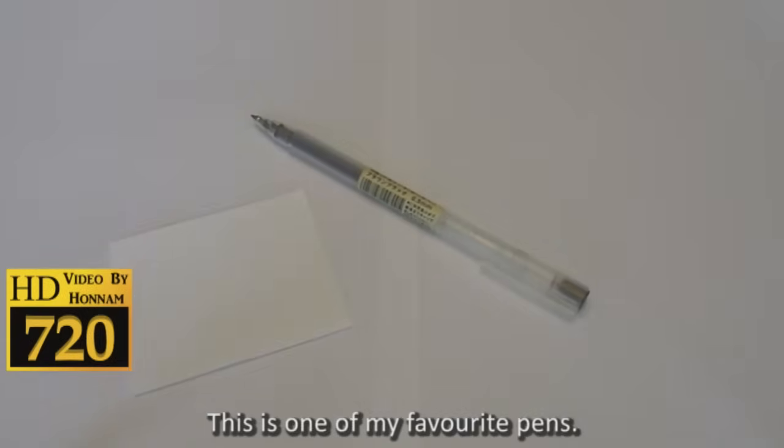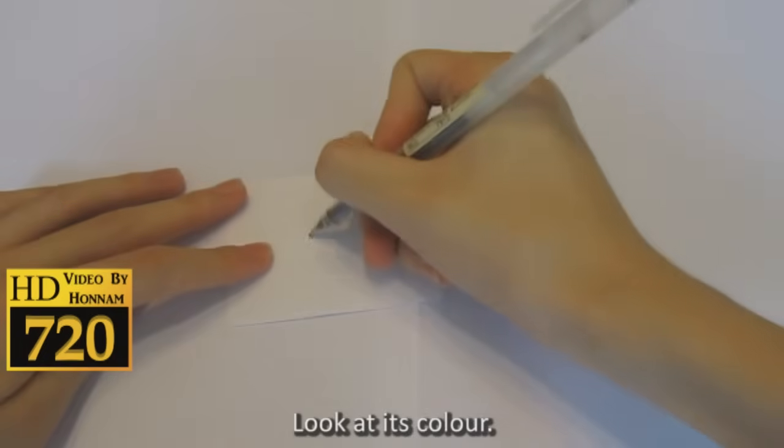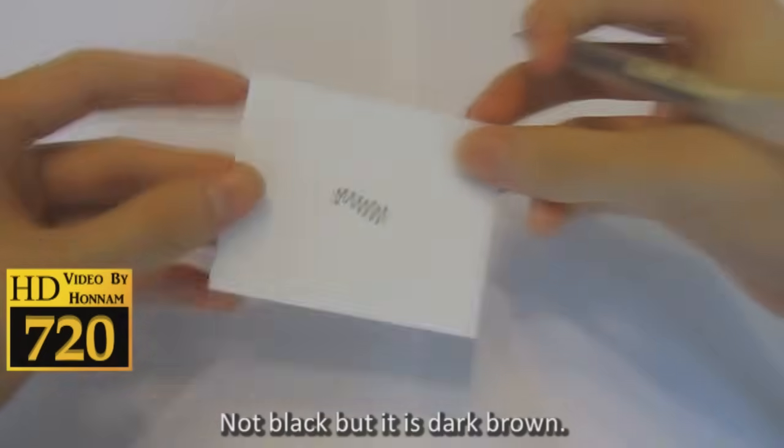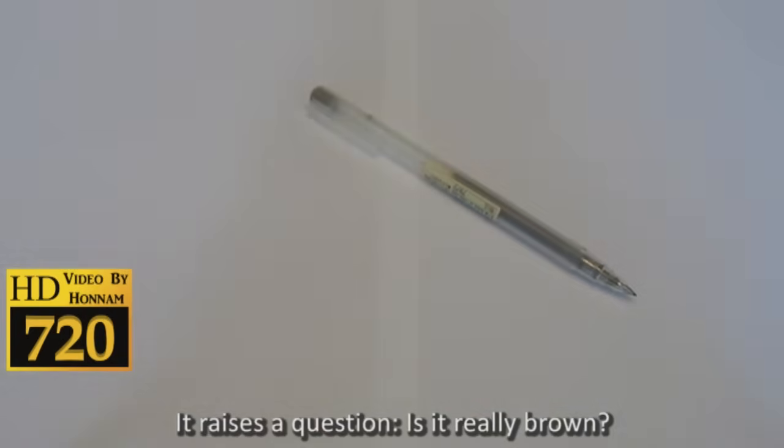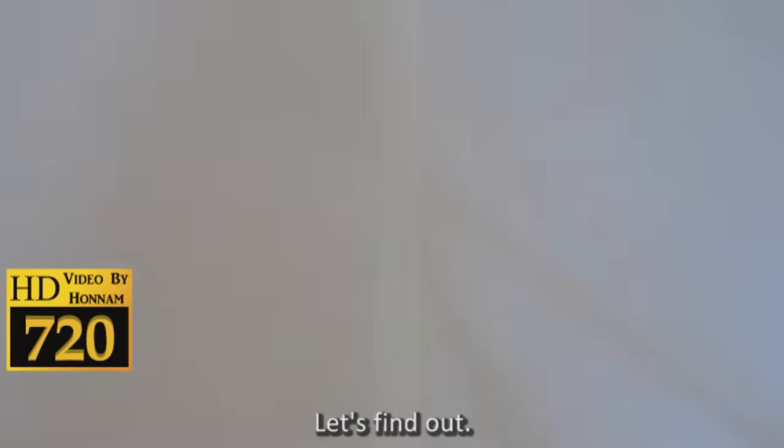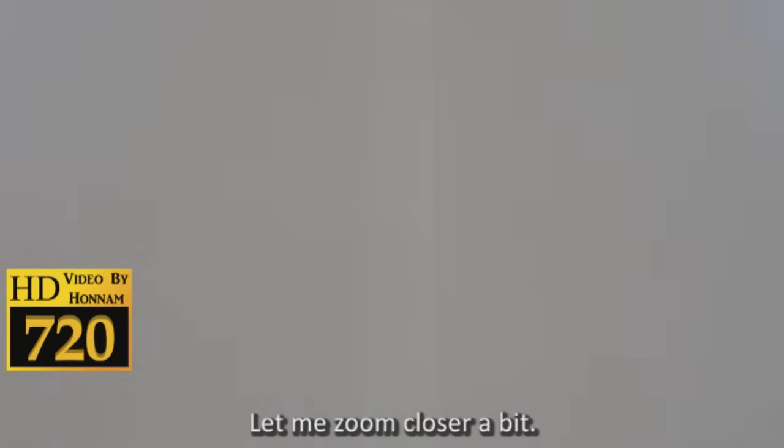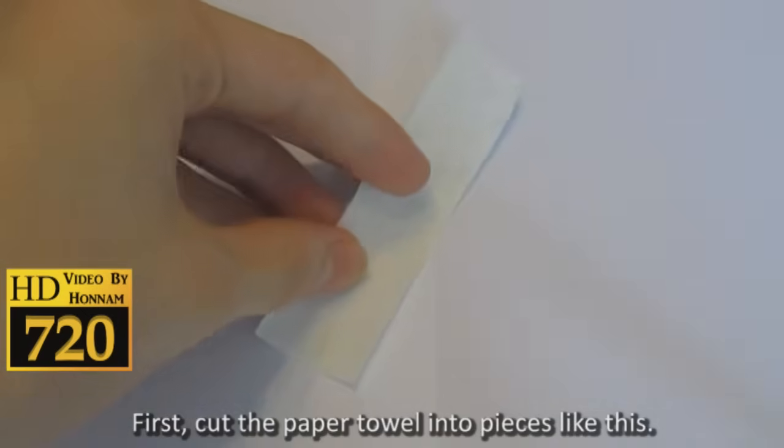This is one of my favorite pens. Look at its color - not black, but dark brown. It raises a question: is it really brown? Let's find out. Let me zoom closer a bit. First, cut the paper towel into pieces like this.